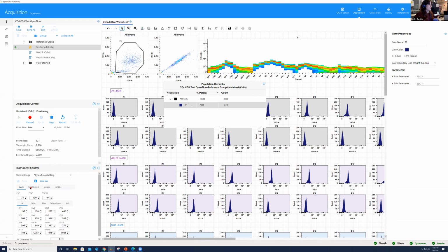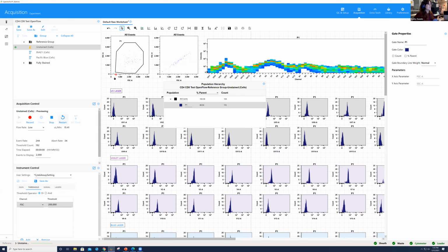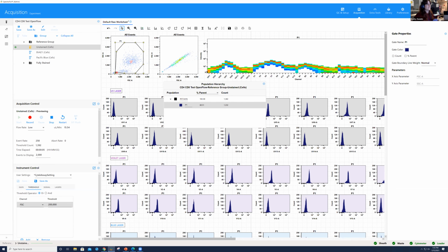So I'm going to go ahead and go to this threshold tab. And each small tick here before 1 million is 200,000. So I typically tend to use that to help me decide what I want the threshold to be. So I'm going to set that at 200,000 and hit enter. And when I restart, what you see is any of the events below that first tick are no longer showing up because we've thresholded them out, okay? So now we have close to 90% in that P1 gate.